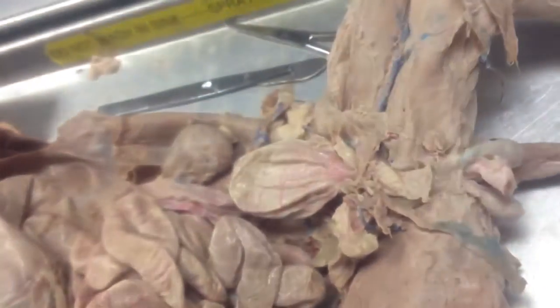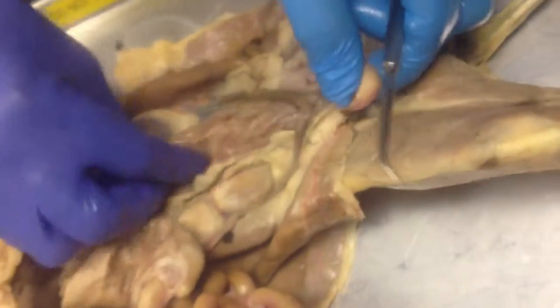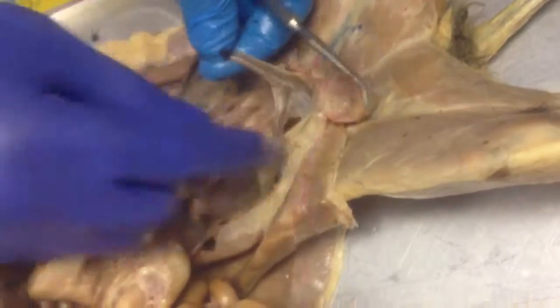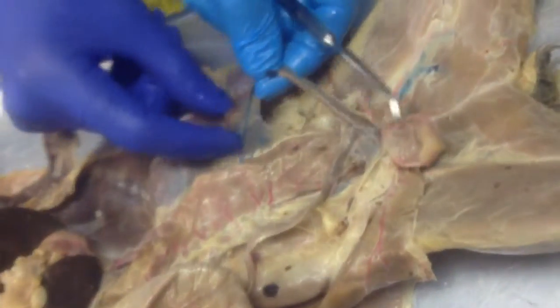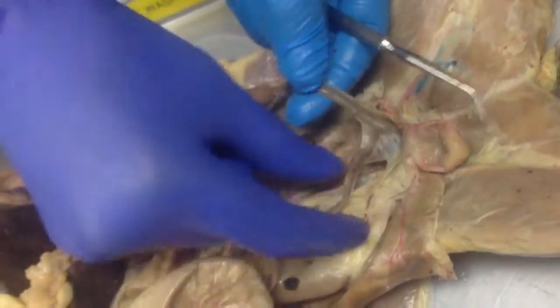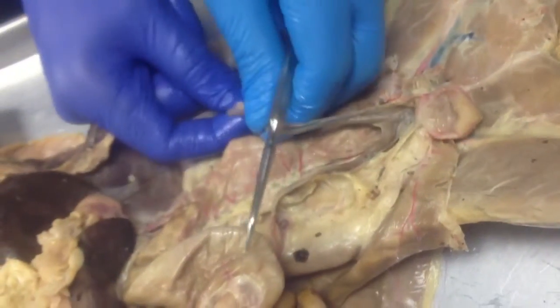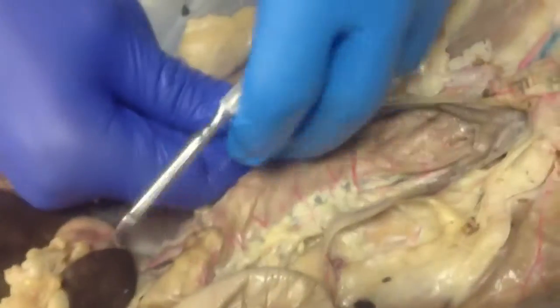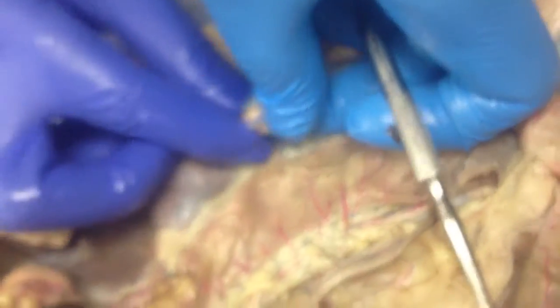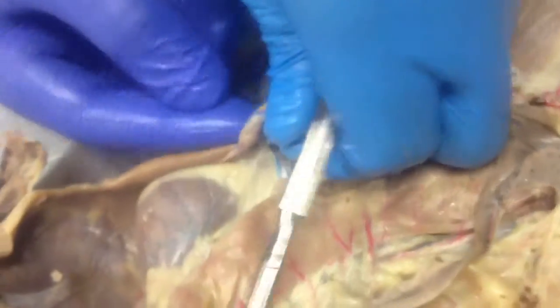So it's a urinary bladder. And between the urinary bladder and the large intestine we have the uterus, which tells us that this is a female cat. And if you follow these here, these are called horns of the uterus. If you follow them all the way to the end here, you will see these tiny pea-sized organs. These are here the ovaries. So these are the ovaries here.